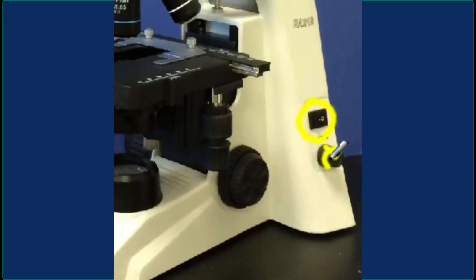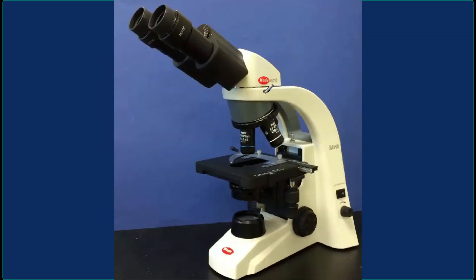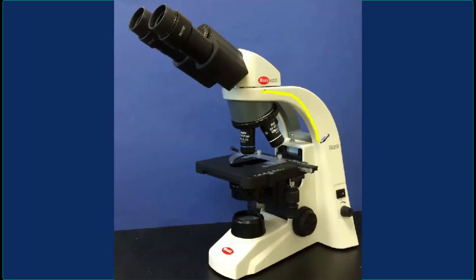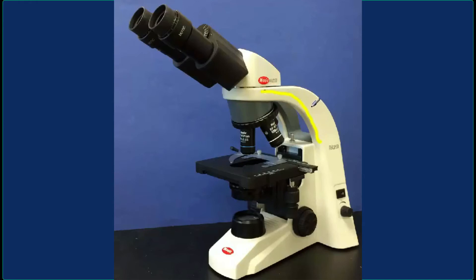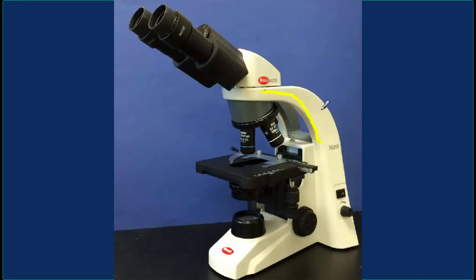Over here we have the light switch — good thing to remember if you don't see anything when you look at the scope. And another good thing to remember if you don't see any light is right over here: this is a rheostat that will adjust the light intensity for you. This part of the scope is simply referred to as the arm, and it is a convenient way to grab and carry the scope.